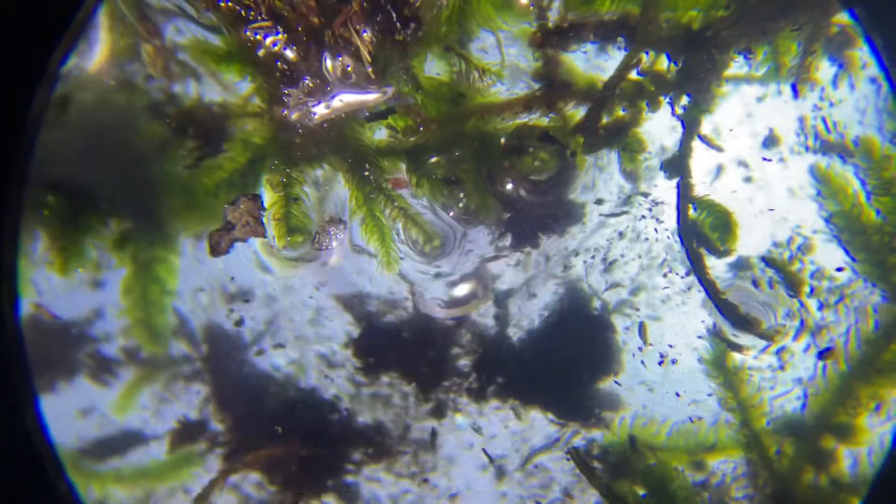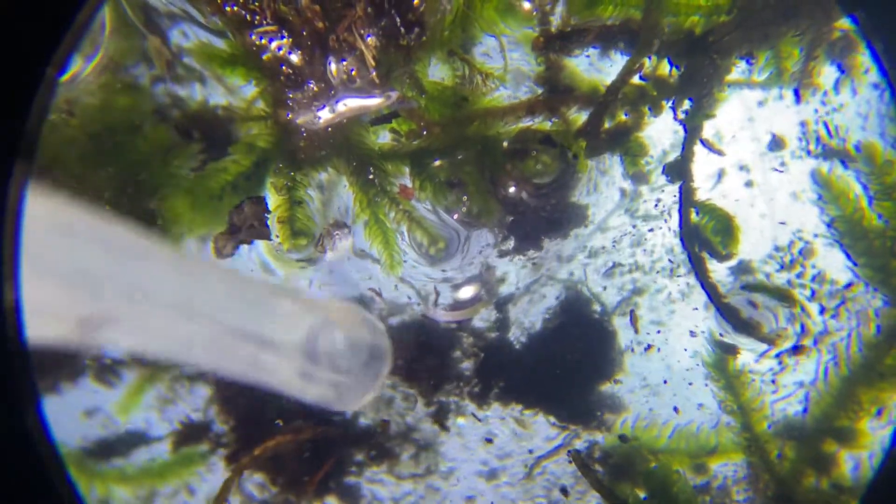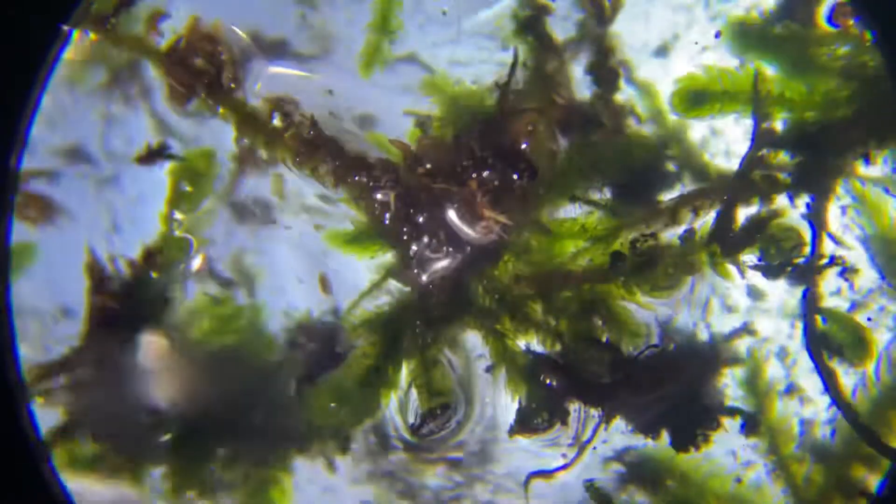Usually I'll look through the moss first and poke out a little bit. This sample has been soaking for about six hours, so it might not even be ready — if there are any water bears that were dried up, they might not be back to life yet.